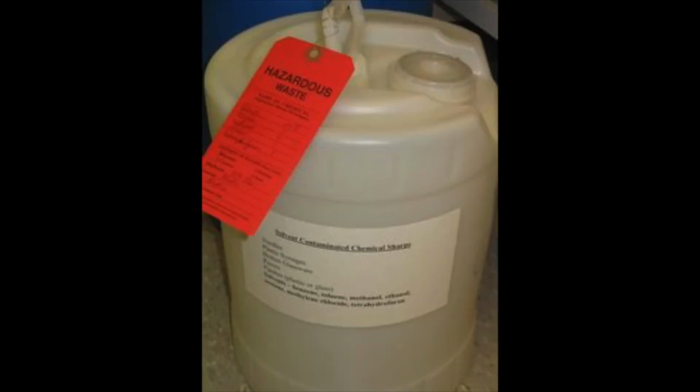At the end of the laboratory, the space is properly cleaned and excess reagent is placed into the proper waste containers.